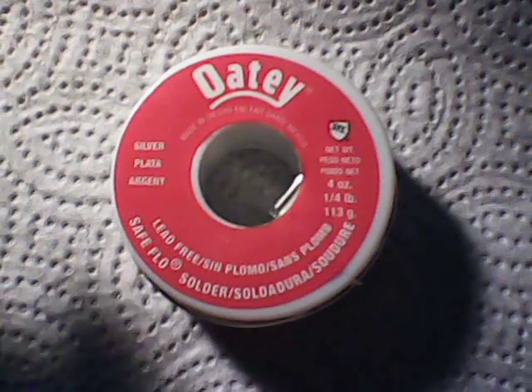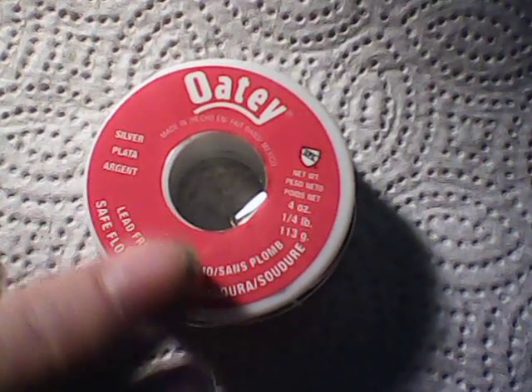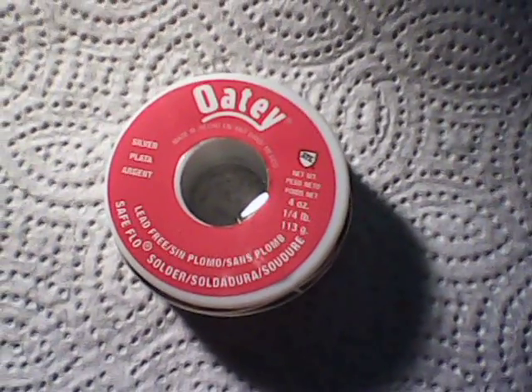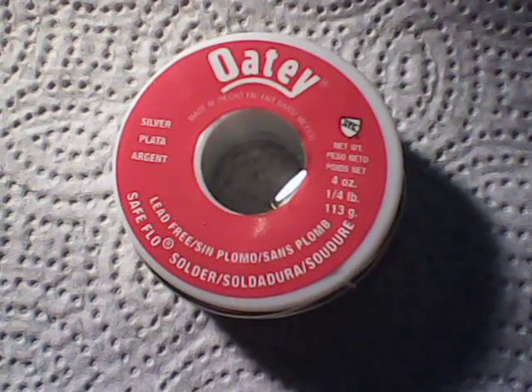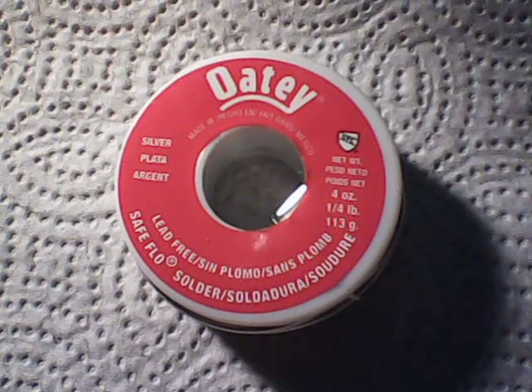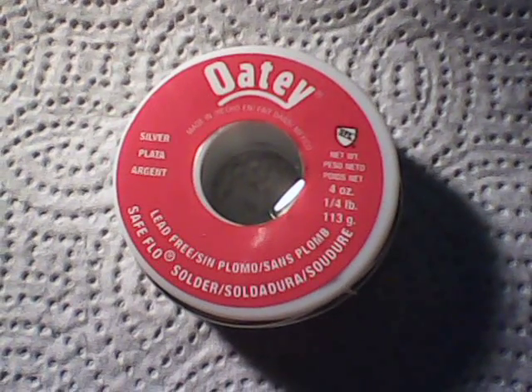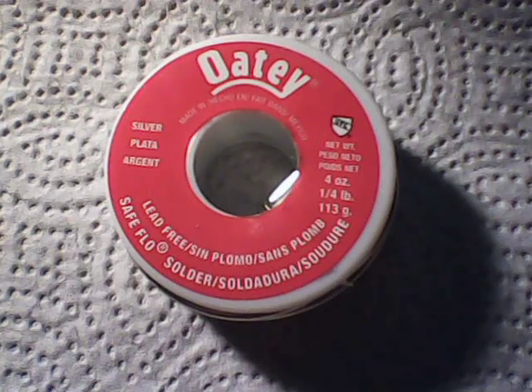The components listed in this roll are tin, copper, antimony, and silver. What I'm going to do is take the whole roll, put it in a container, put hydrochloric acid in it and see if I can dissolve the tin away from the solder. Hopefully that will leave me the other components, which are going to be the copper, antimony, and silver.